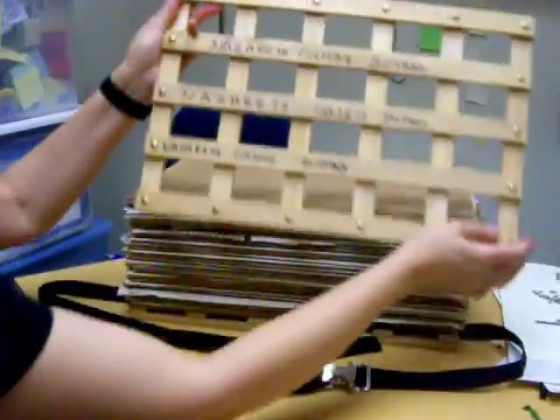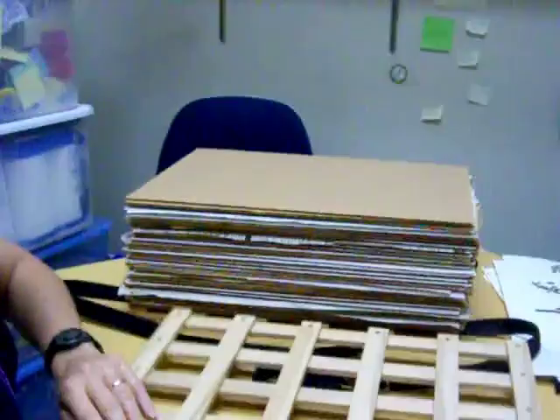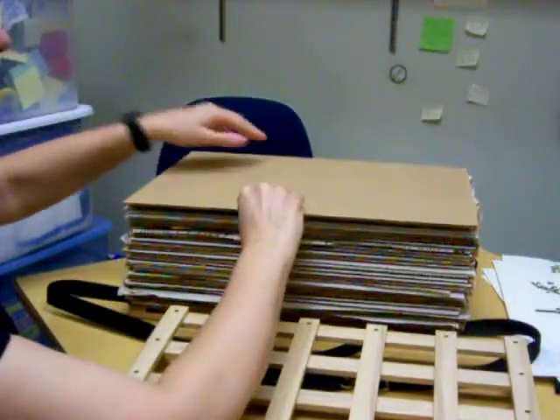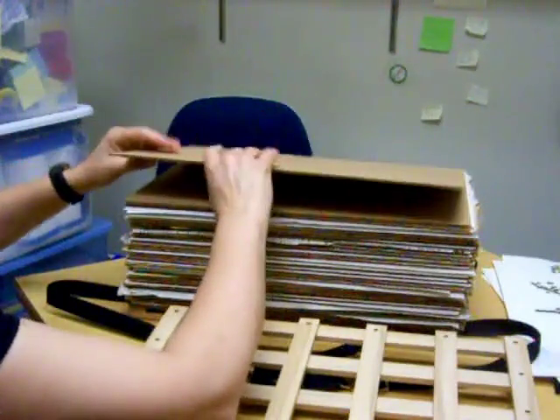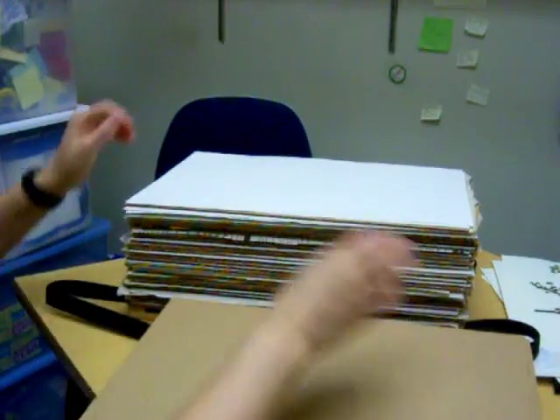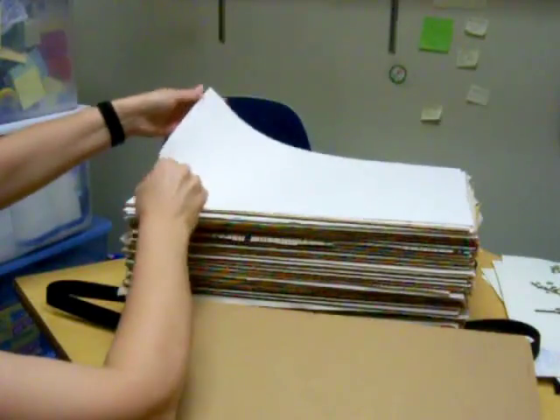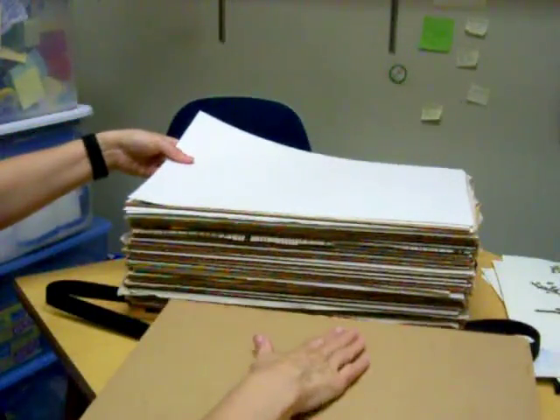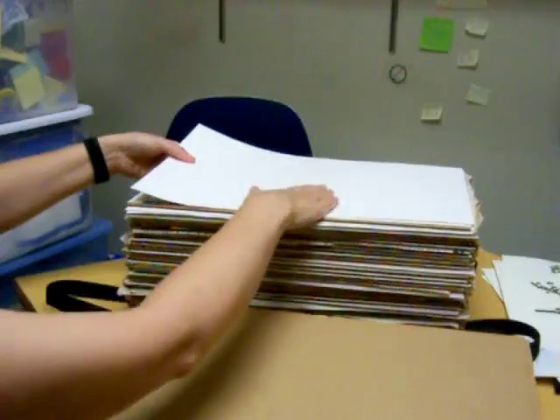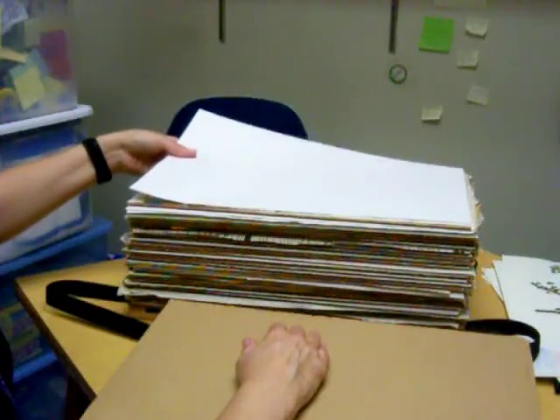When you take the cover off you'll notice that the numbers are up in the upper left-hand corner and these are in a particular order. There are always two cardboard pieces and you always want to flip them completely over. There are always two pieces of cardboard on the top and on the very bottom; otherwise there's only one piece.